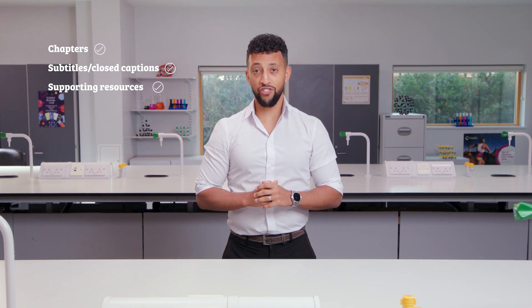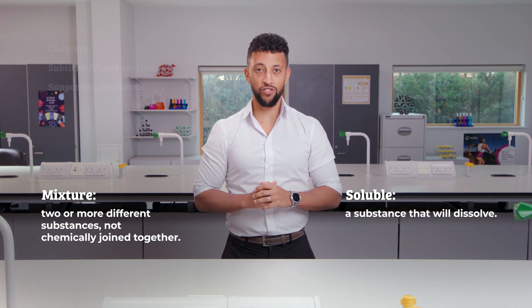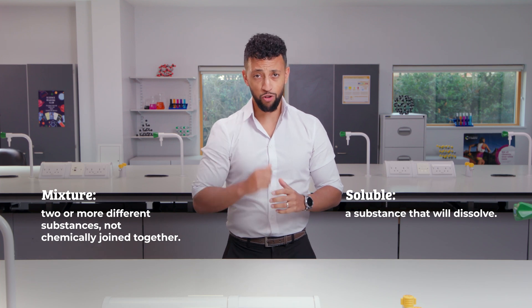Today I'm going to show you a technique for separating mixtures of soluble substances. This method is called chromatography.